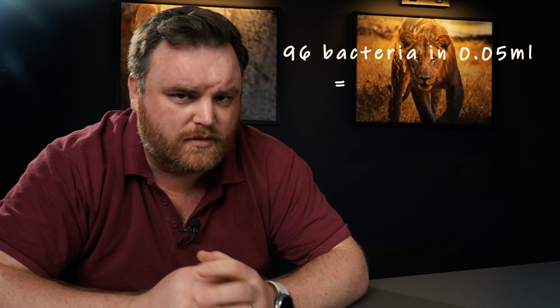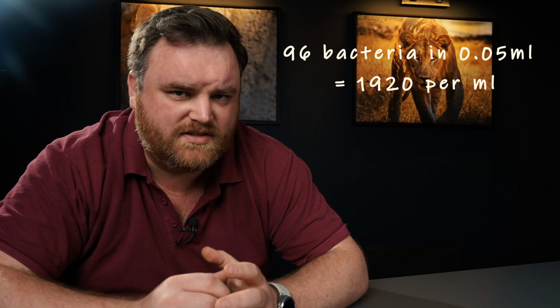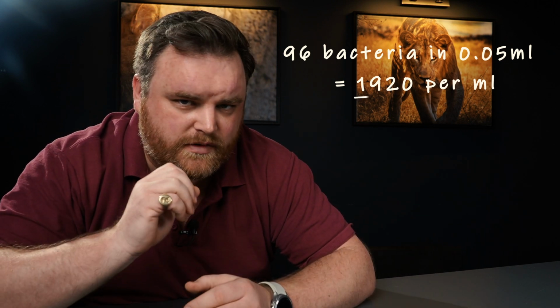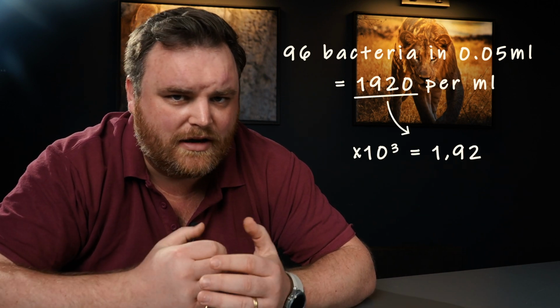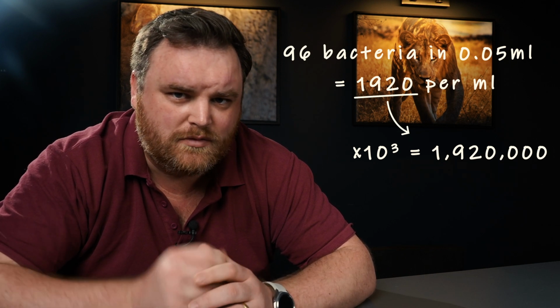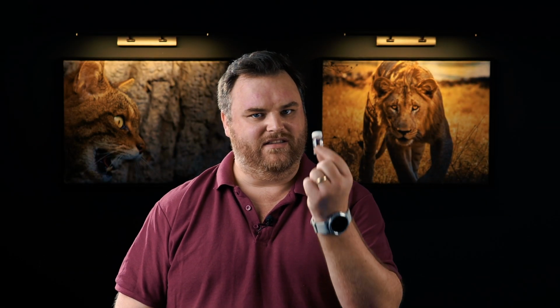That was in our sample of 1 drop, which is about a 20th of a milliliter, so that's equivalent to just under 2,000 bacteria in 1 centimeter cubed. 3 1 in 10 dilutions were made from the original sample, which means we need to multiply our 2,000 by 10 to the power 3. That's just under 2 million bacteria per centimeter cubed in our original bottle. So that's how we answer our question. 2 million bacteria in every milliliter in this bottle.